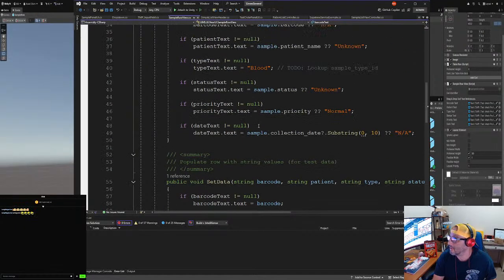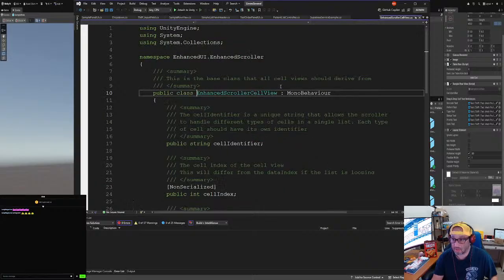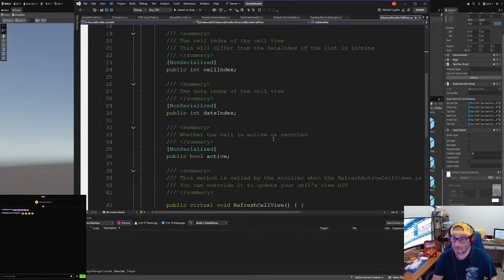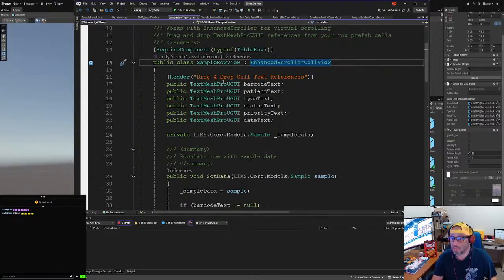So basically, we just made a script called SampleRowView, and that's going to be the prefab for the enhanced scroller. We derived it from the enhanced scroller plugin class, EnhancedScrollerCellView. That's all we do. And then we assign all the strings that are going to be in the interface, which are just TextMeshPro UI elements.